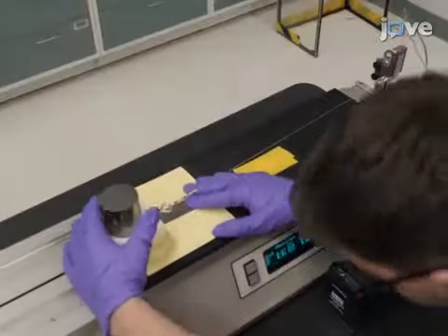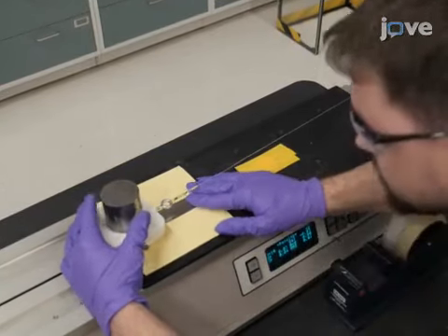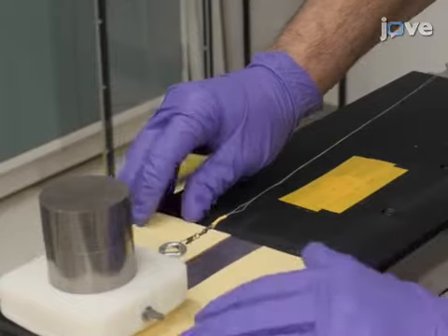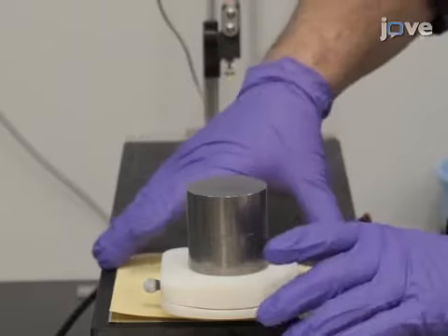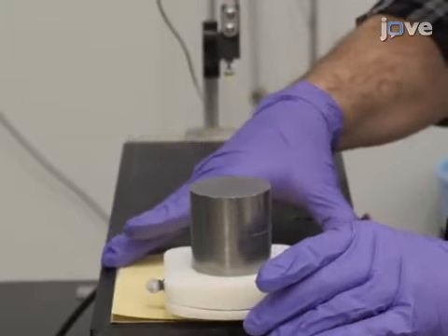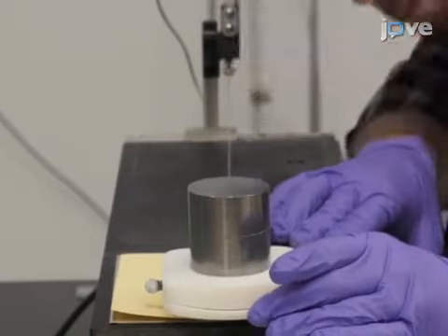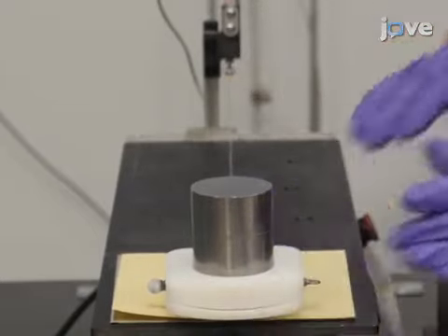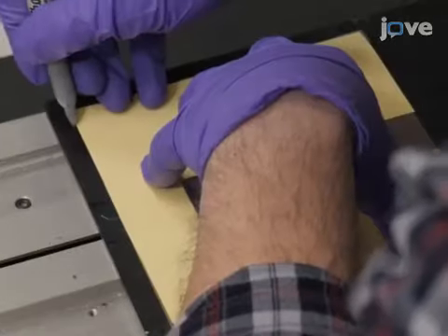Next, move the surface and template back and forth on the plane until the wipe sits on the starting location, when the restraining wire is taut. Then, move the surface and template side to side until the restraining wire is centered down the travel path. The position of the surface on the plane is now correct. Mark this location.